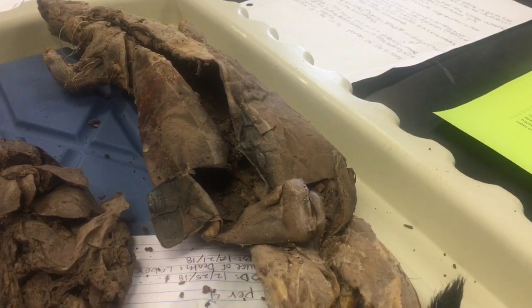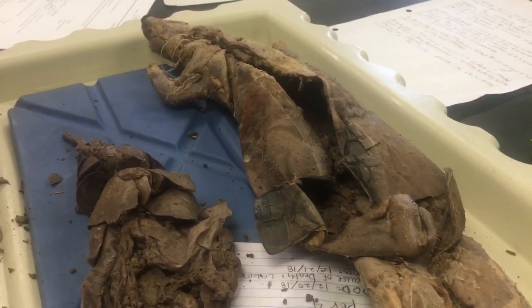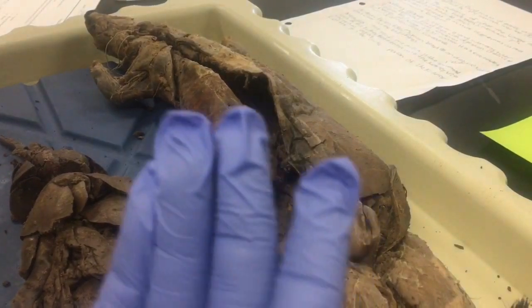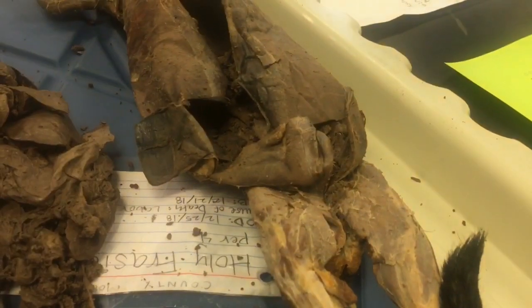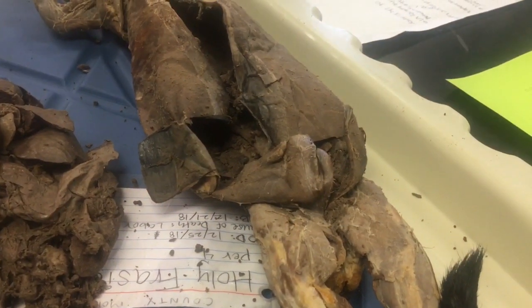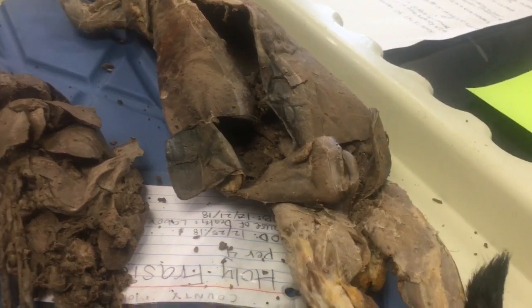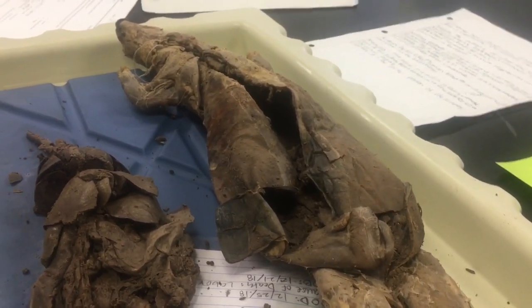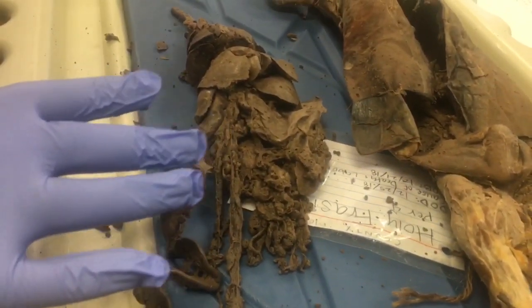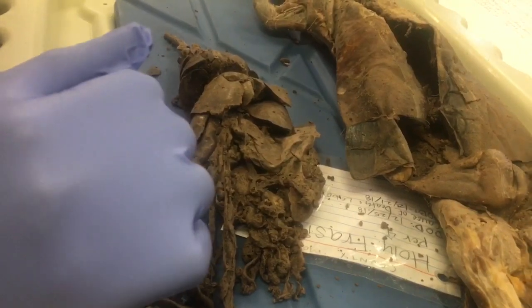Waste is basically the outcome of what the large intestine makes, and it contains a lot of body toxins, and is eventually eliminated through the anus of the mink and also other animals. And the pancreas secretes a mixture of enzymes called pancreatins for digestion. Sadly, we are unable to label that on the mink because of the mink's condition.